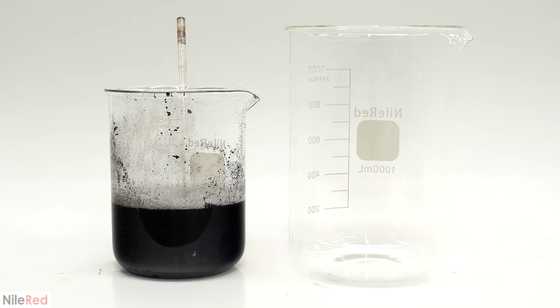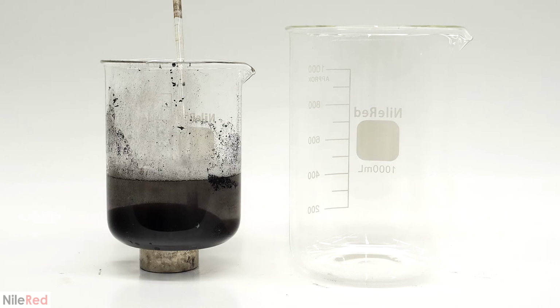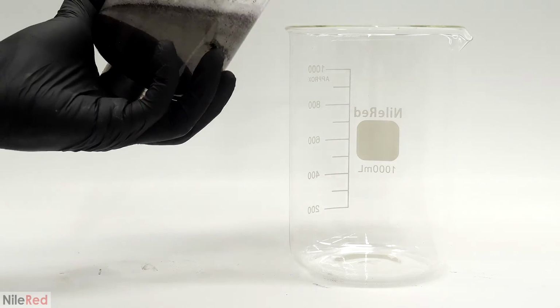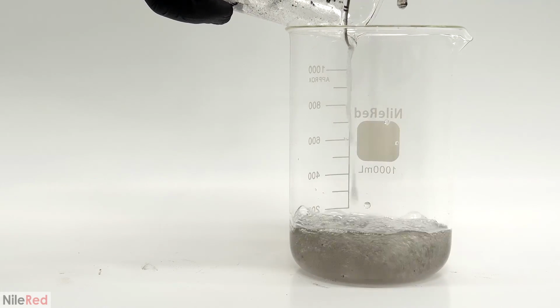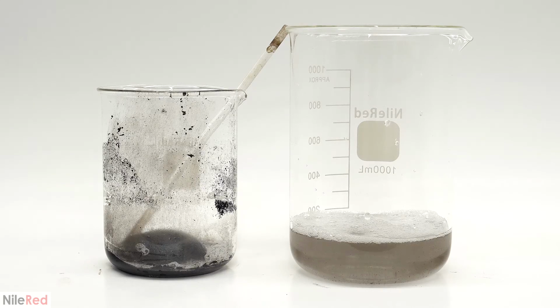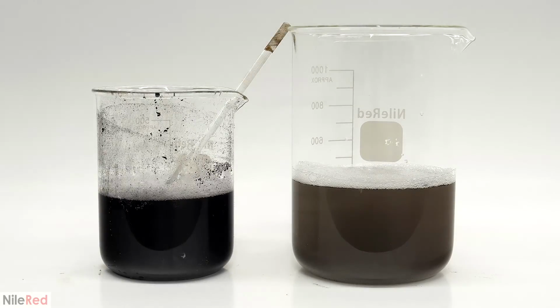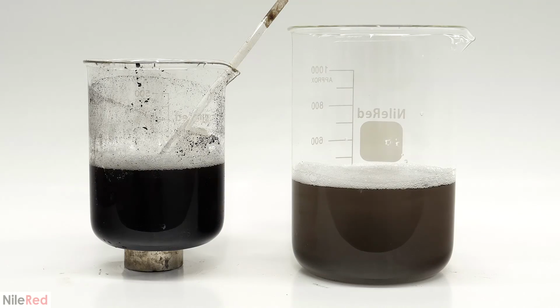After doing this for a bit, and when I felt like I had broken up all the solid pieces, I put a magnet under it and I counted to about 5 seconds. The highly magnetic particles separated out really quickly, but the weaker ones needed more time. So not only did this let me clean up the magnetite and wash away reaction side products, it also helped me weed out some of the crappier particles. This water wash was done a total of 3 times, and then I moved on to washing it with isopropanol.